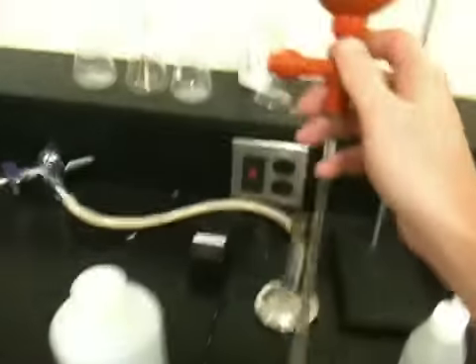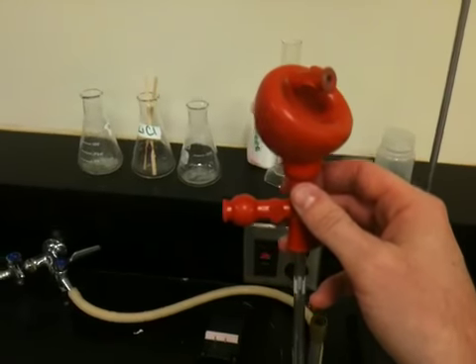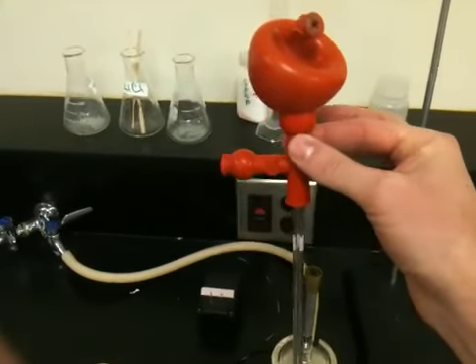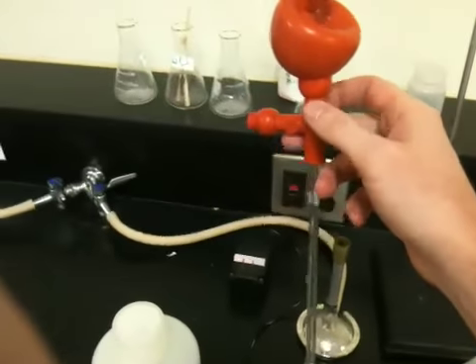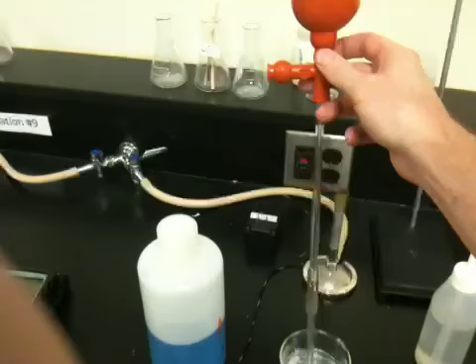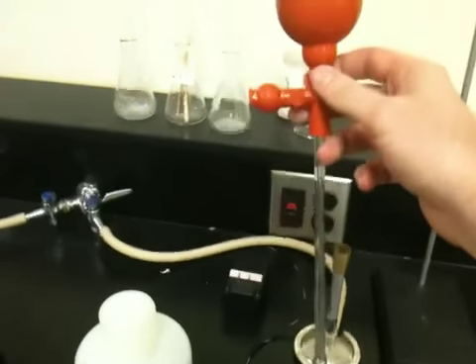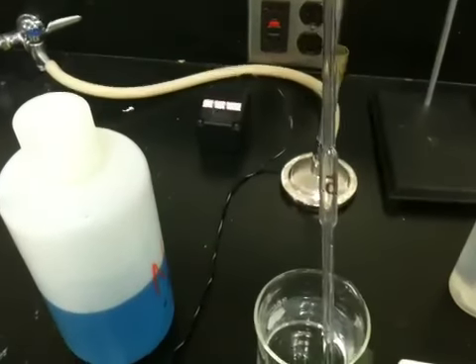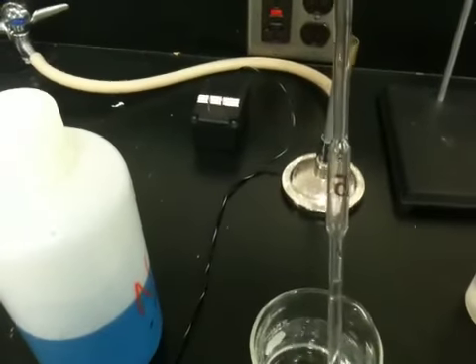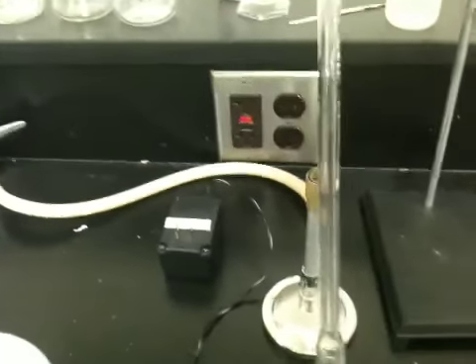So I'm going to put it in the water here and practice drawing up the water. I draw up the liquid by squeezing this valve where I have my fingers on it, this one right there. When I pinch it, my water should start going up the volumetric pipette, because there's lower pressure here than there is in the outside atmosphere, and liquid should start rising. So let's see if we can see it rise. There it goes.